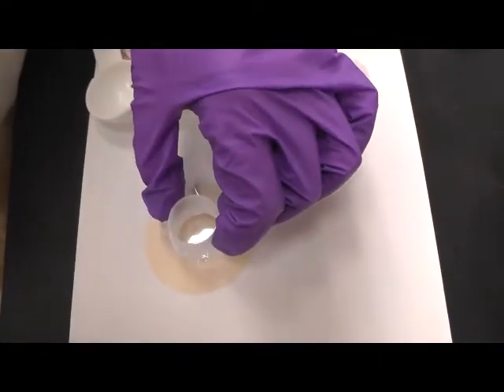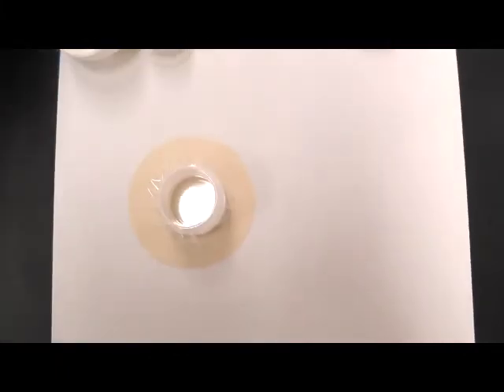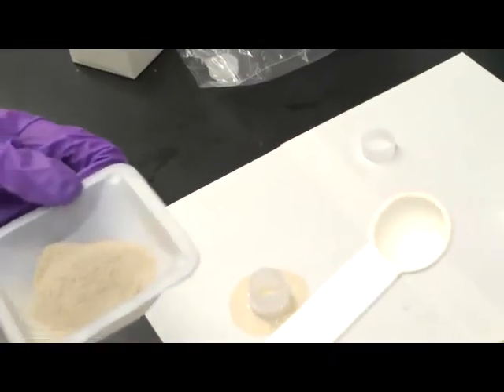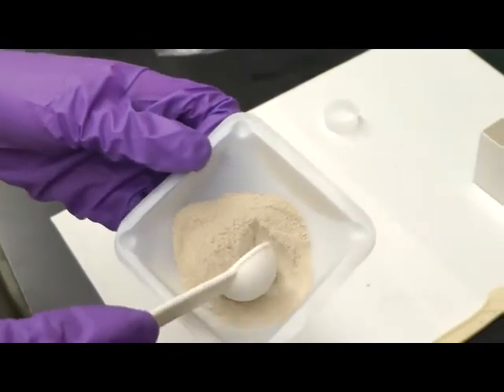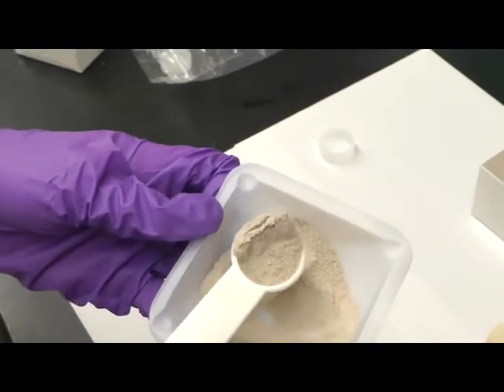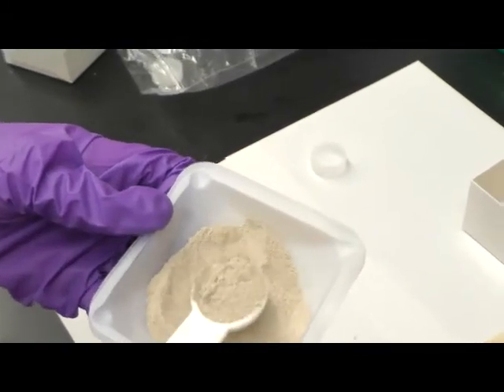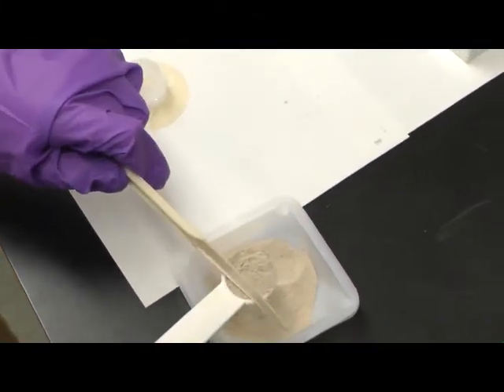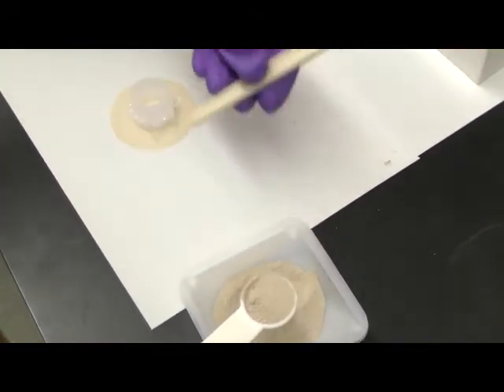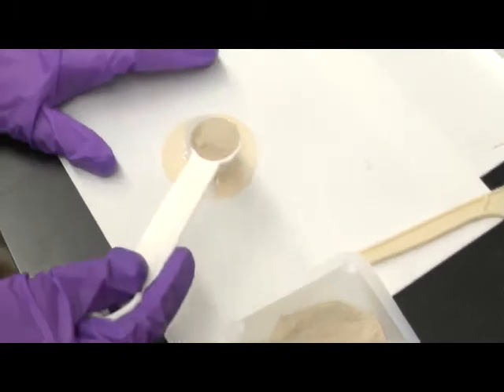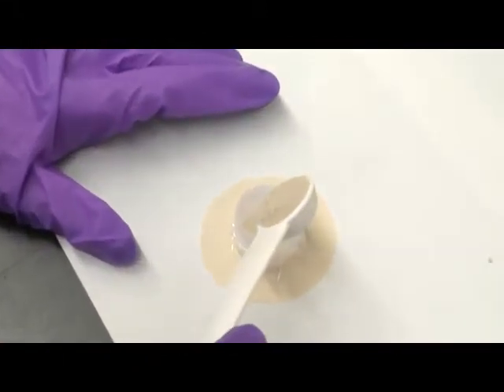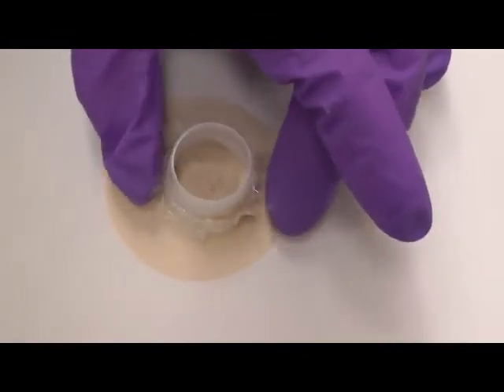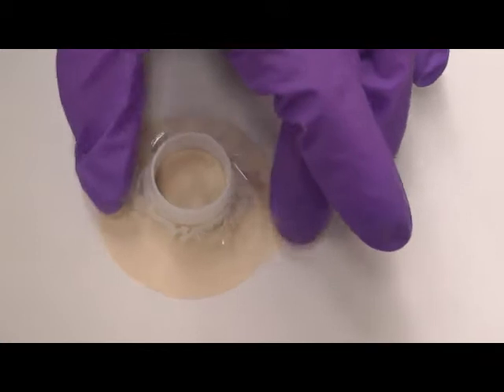Now we will be ready to put soil inside such a cup. And here is a teaspoon. And basically we only need one full teaspoon of soil. Alright, so this is enough. And then gently shake it so the soil is packed.